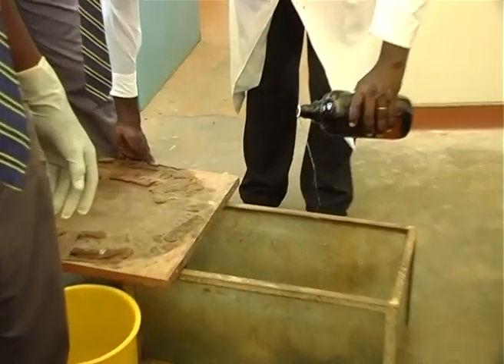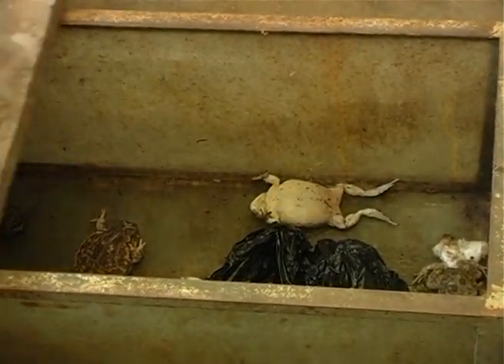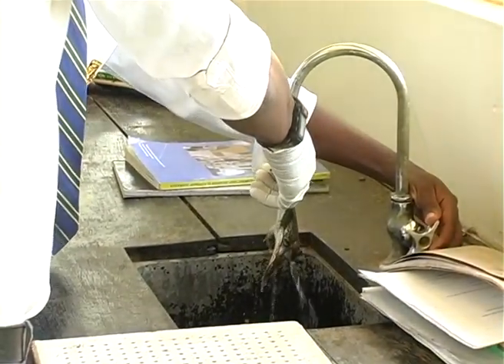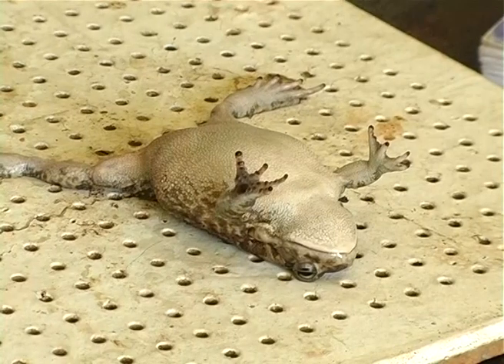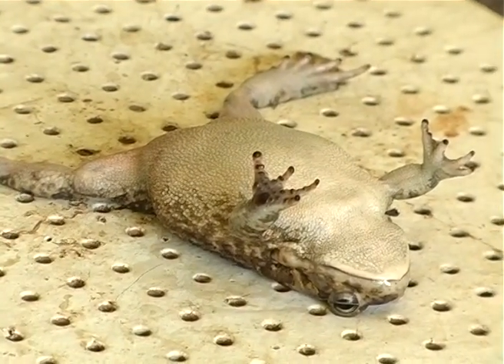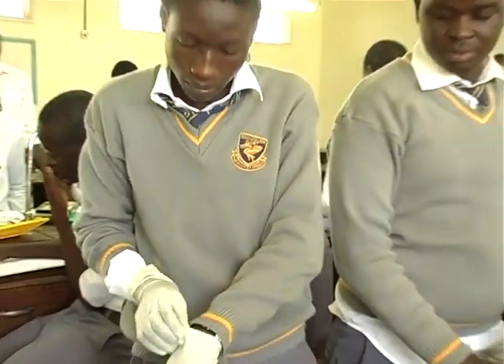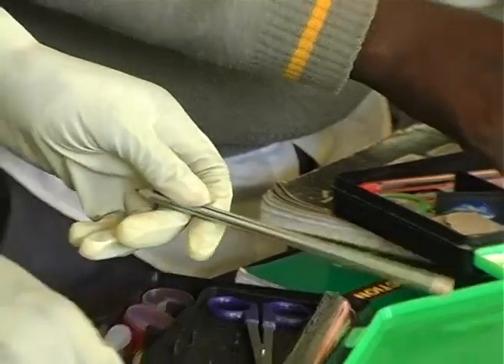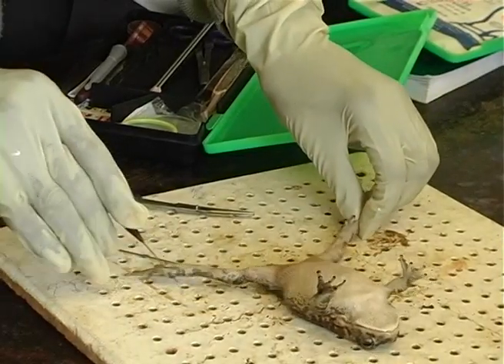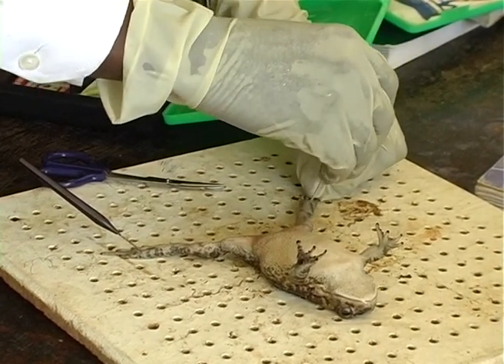The animals are ready. I hope you identify those muscles, okay? Don't overstretch — remember you need to grip the skin.